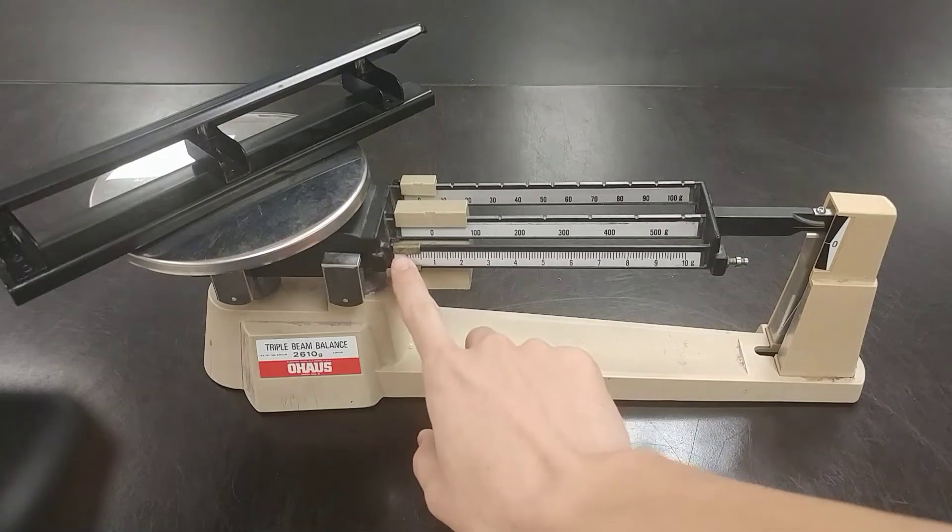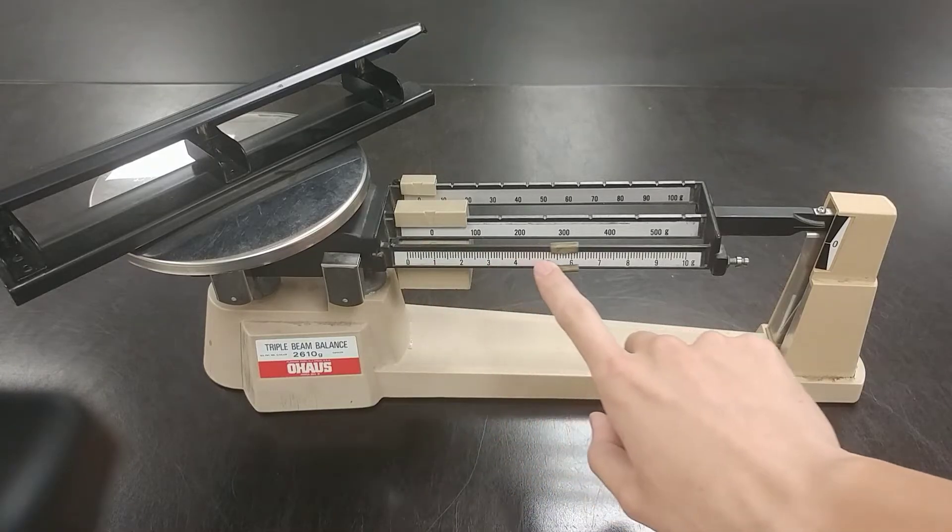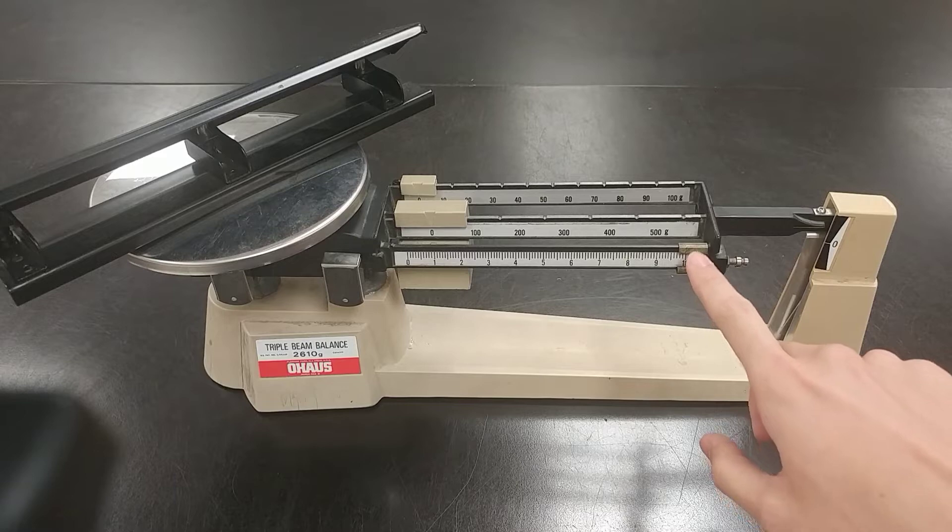We move the smallest weight, which can be anywhere along this scale all the way to the end, and nothing happens. That means we're going to move it back.